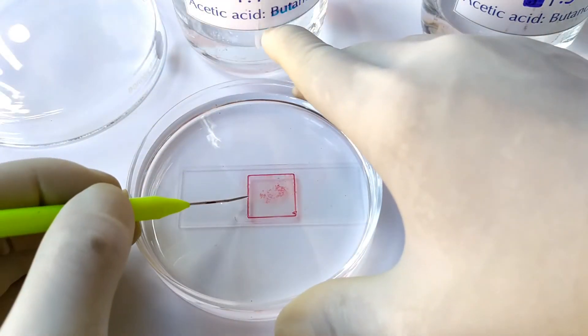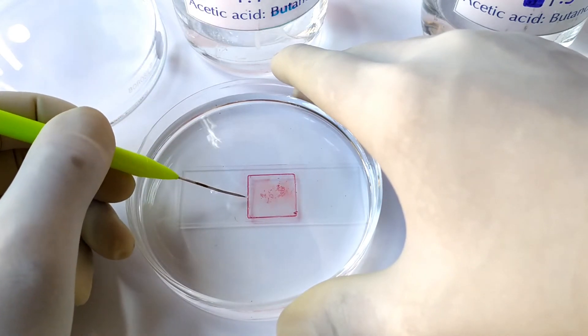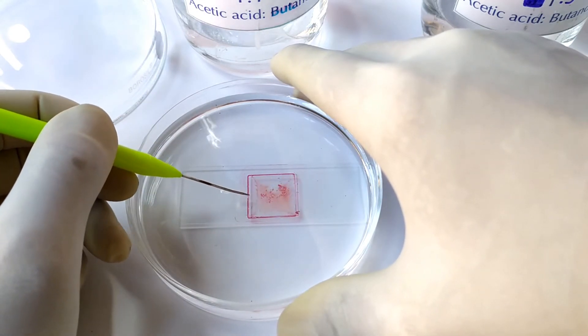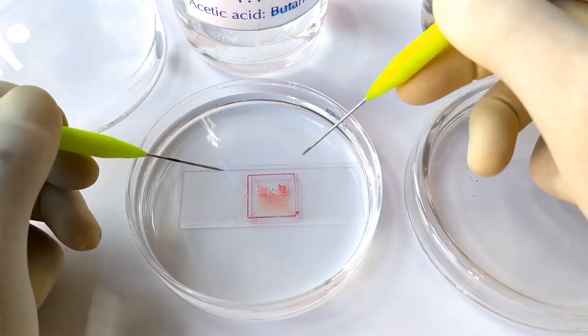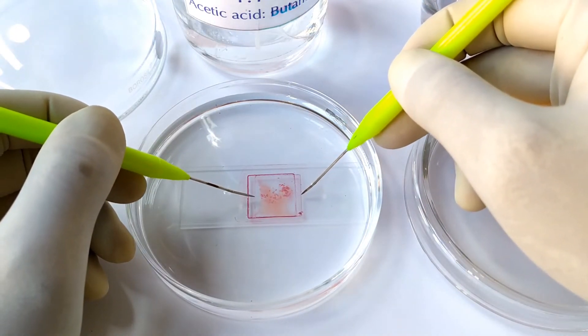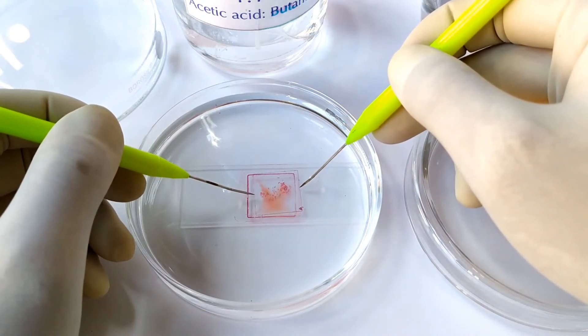During this time, carefully loosen the cover slip from the slide using a pin or tweezer and slightly move the cover slip to and fro on the slide surface to allow the solvent to properly seep in between the slide and cover glass.